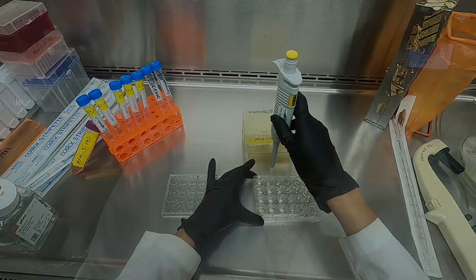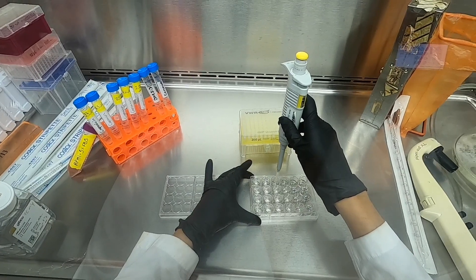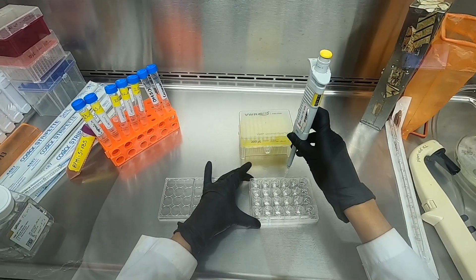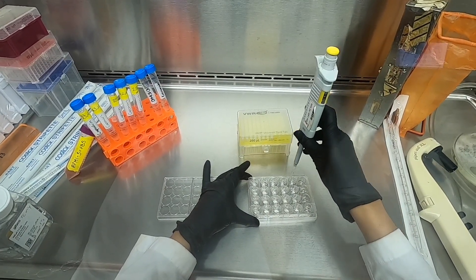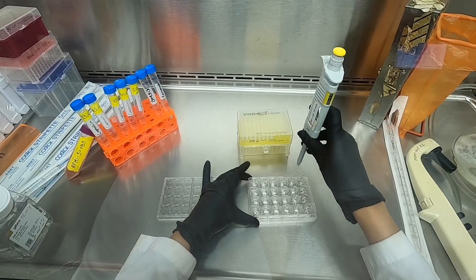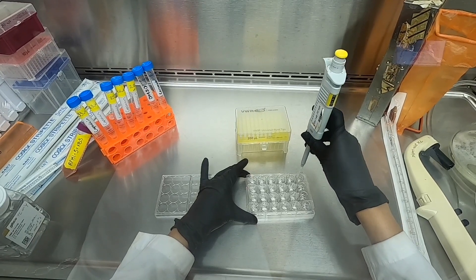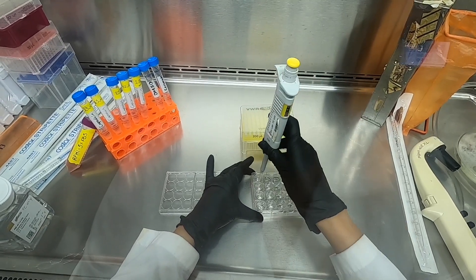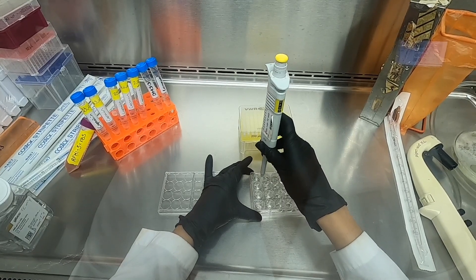Using the micropipette tip we will now scratch perpendicular to the black marker line. As we mentioned before, this black marker line will serve as a reference in order to take the picture of the wound at the same position every time.